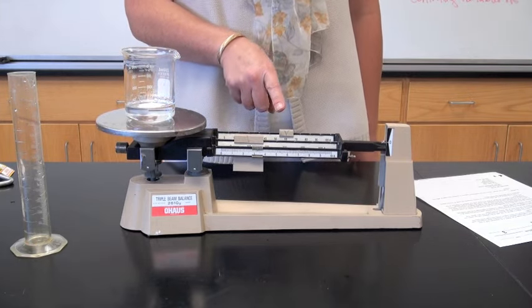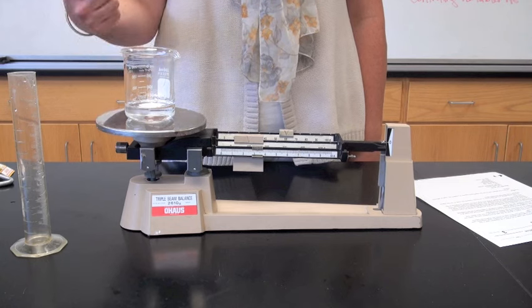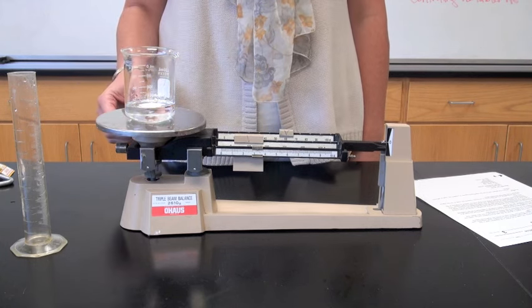I add up the numbers, and record my result for the mass of the beaker with the water, and now I subtract the mass of the beaker alone, to get the mass of the water alone.